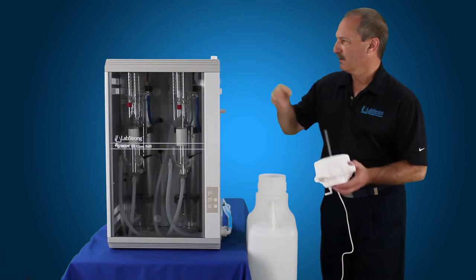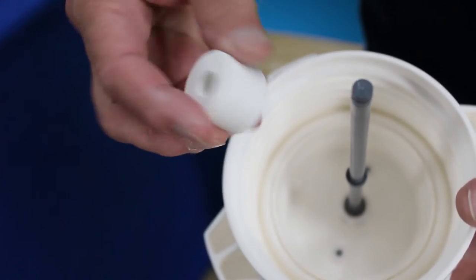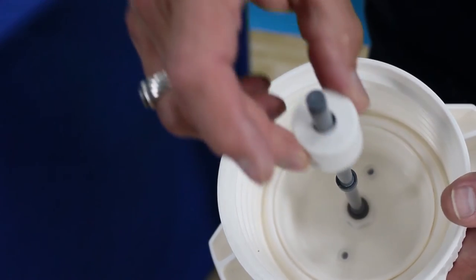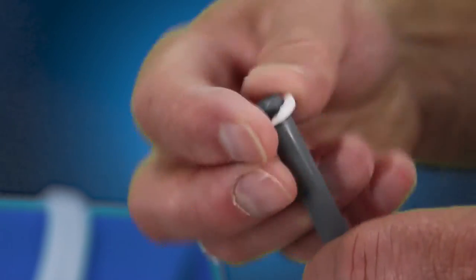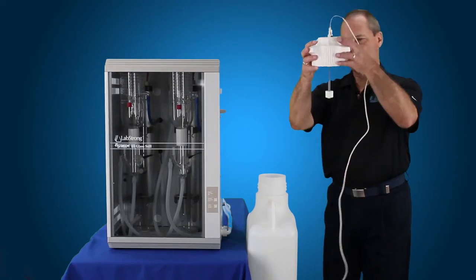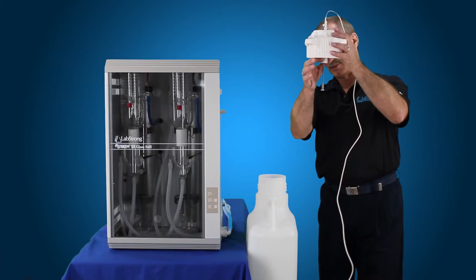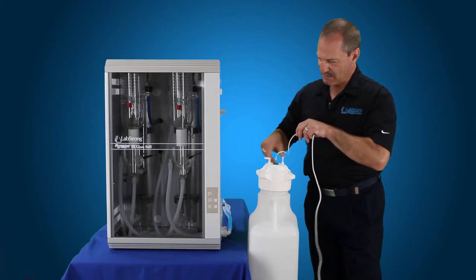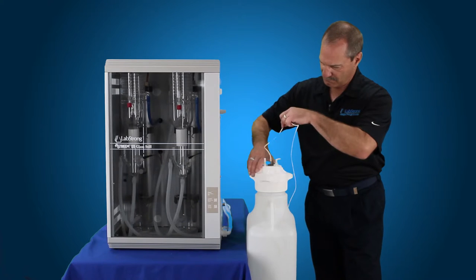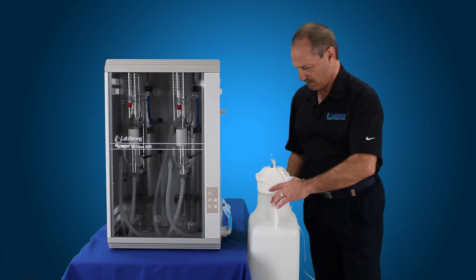Once you have that tight — you don't really need any kind of a wrench to tighten that down, just hand tight — make sure the lettering is at the top and then the clip goes back on the bottom spacer. This is the position for our float when it's empty; this is the position when it's full. Drop that down inside the tank and thread that into place.